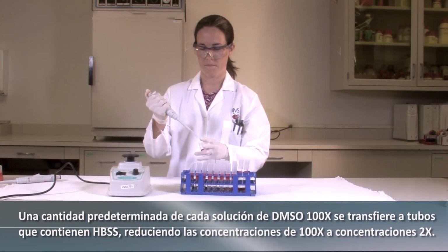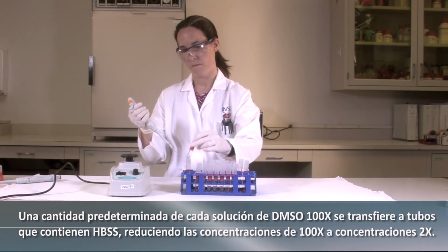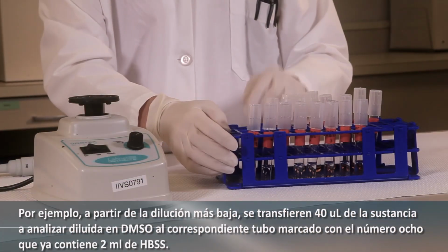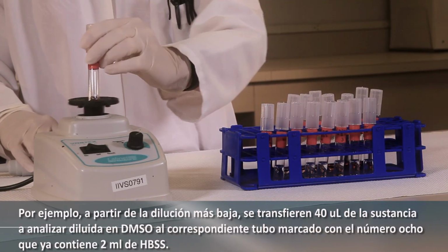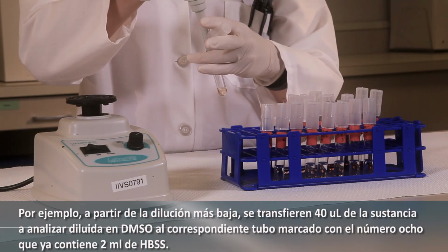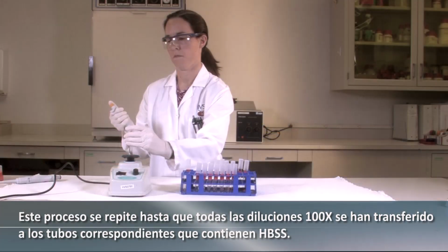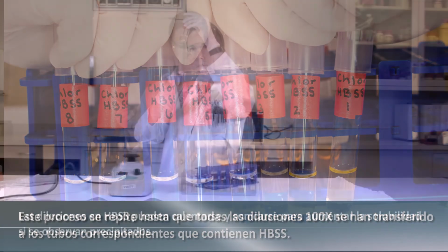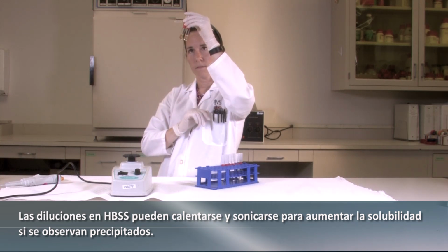A predetermined amount from each 100x DMSO solution is transferred to tubes containing HBSS, reducing the 100x concentrations to 2x concentrations. For example, starting with the lowest dilution, tube number 8, 40 microliters of the test substance diluted in DMSO, or 100x dilution, are transferred to the corresponding tube labeled with the number 8, already containing 2 mL of HBSS, or 2x dilution. This process is repeated until all 100x dilutions have been transferred to the corresponding tubes containing HBSS. The dilutions in HBSS may be heated and sonicated to increase solubility if precipitates are observed.